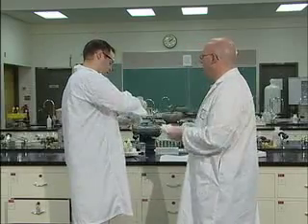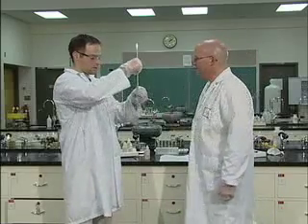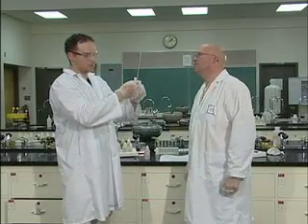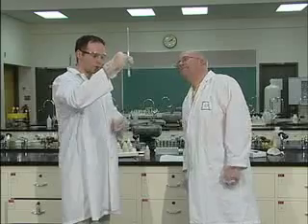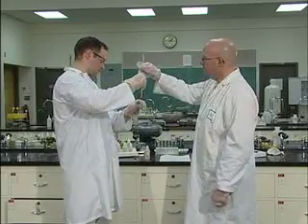Now, to that, we also have to record a temperature change. Thank you, Jeff, for cleaning that thermometer. And generally speaking, with this one, we don't see much of a temperature change, if any at all. Oh, interesting, it certainly doesn't have much of a temperature change. I saw precipitate happening, though. Definitely some precipitate, not too much of a temperature change.